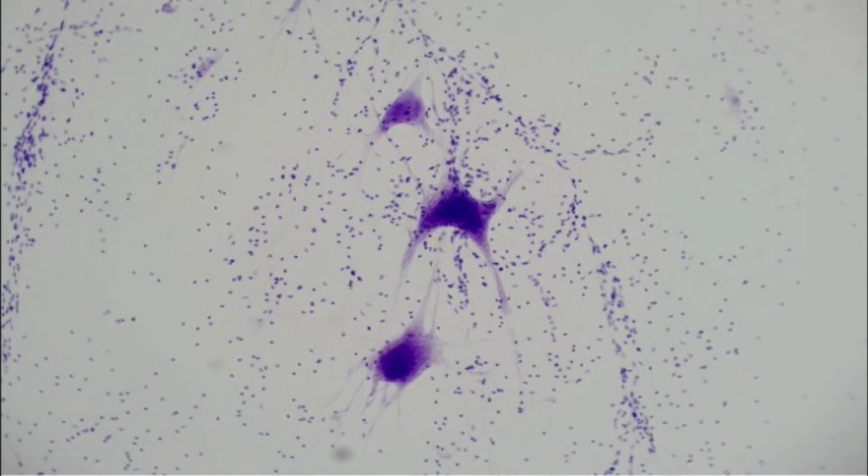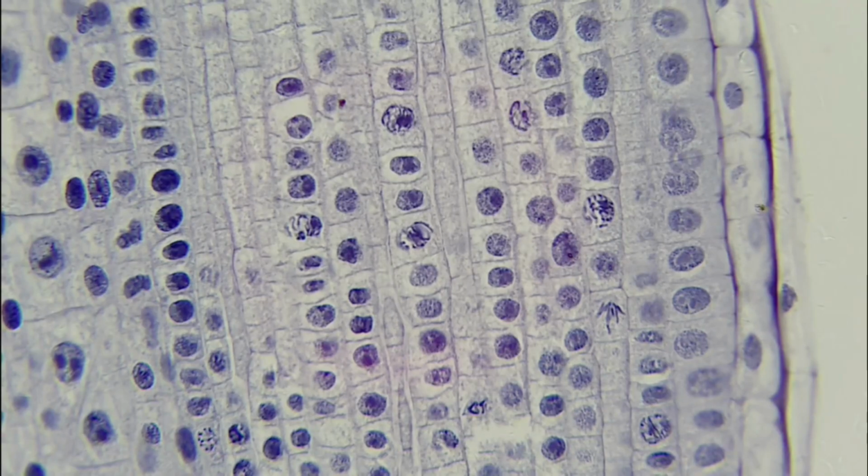And so next we're going to look at mitosis and the stages of mitosis. So let's get into that. All right, so in looking at mitosis, there's a couple important things to note. First is we're going to be looking at mitosis in both plant and animal, so don't just look at one or the other. Look at both and try and compare and contrast the way mitosis looks. What we're currently looking at right now is stages of plant cell mitosis, but we're going to get into animal cell mitosis here in a bit.